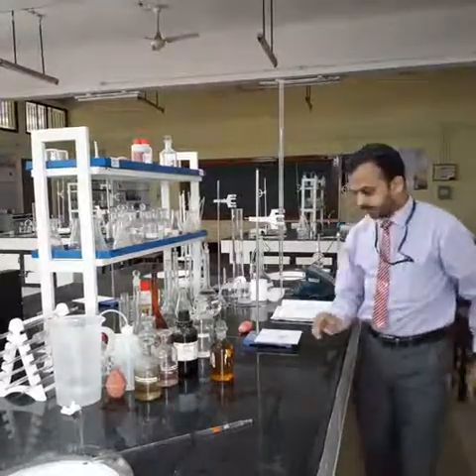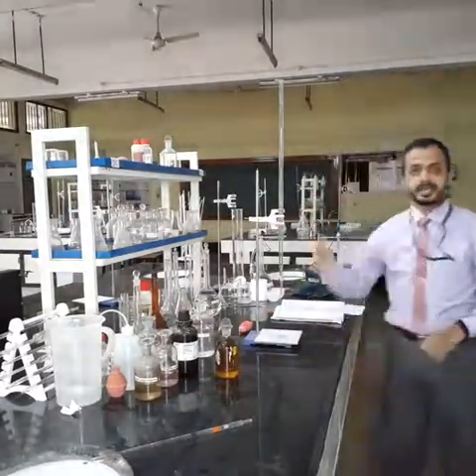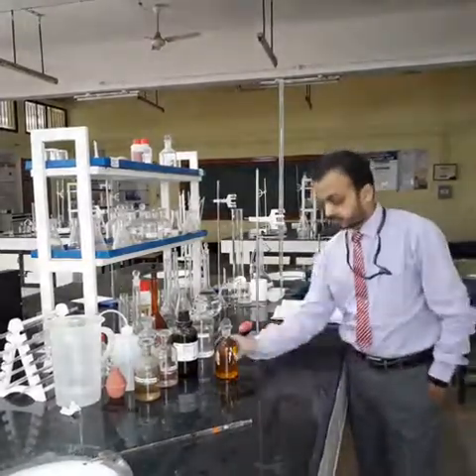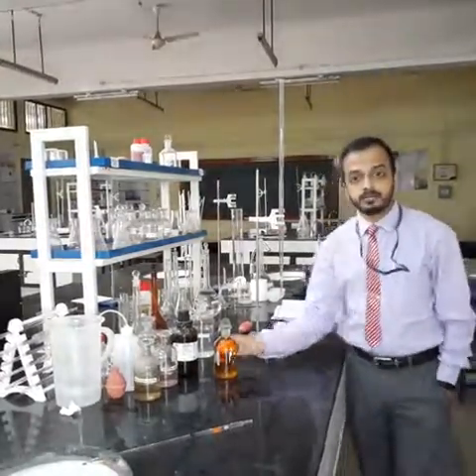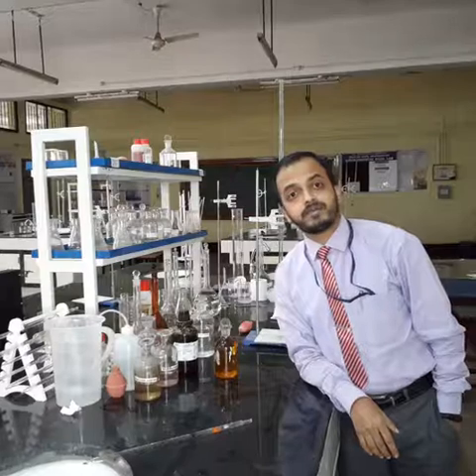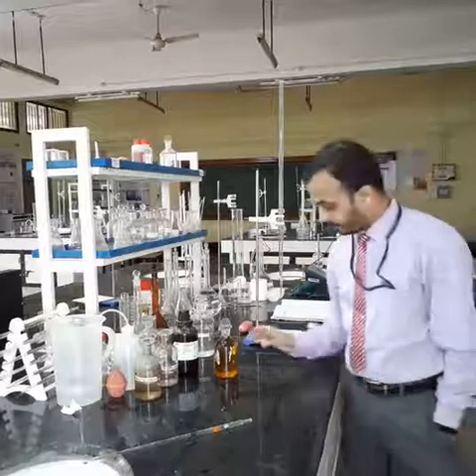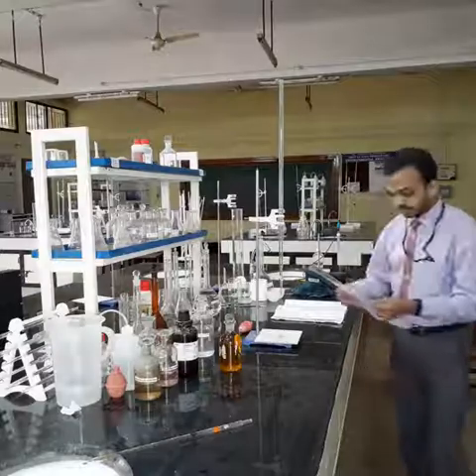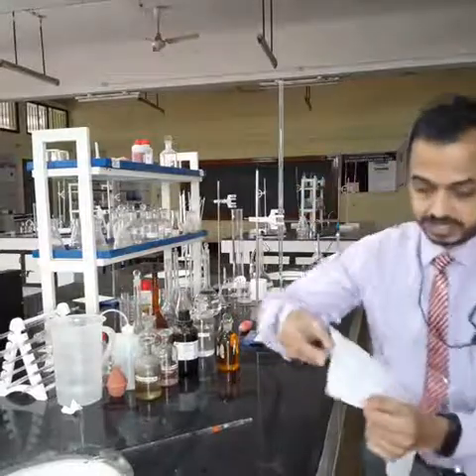Now I need to take 203 ml of this solution into a conical flask and titrate with sodium thiosulfate of 0.025 normality. Now the question arises, why do I have to take 203 ml only? Why not 200 ml or 100 ml? Because in most cases we take the sample in the scale of 50 ml or multiples of 50, which comes out to be around 100 ml, 200 ml like that. But here in this case we are taking 203 ml of the sample. The reason is a calculation. You can see the calculations here.